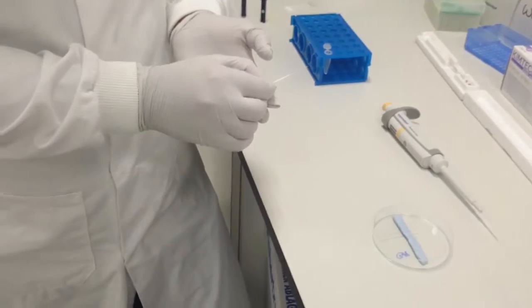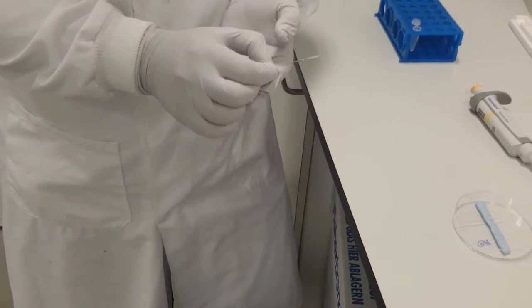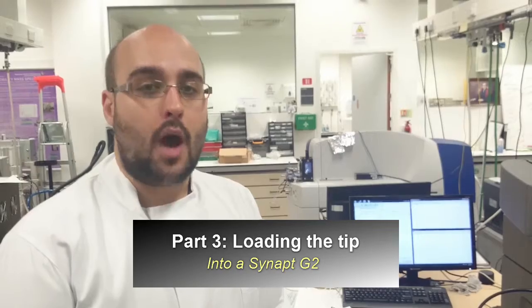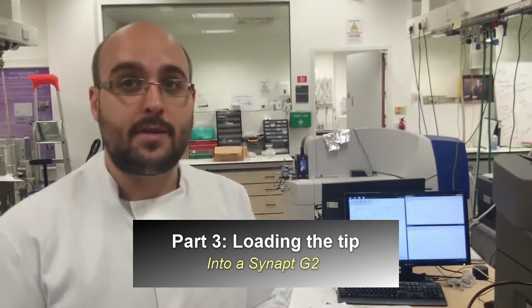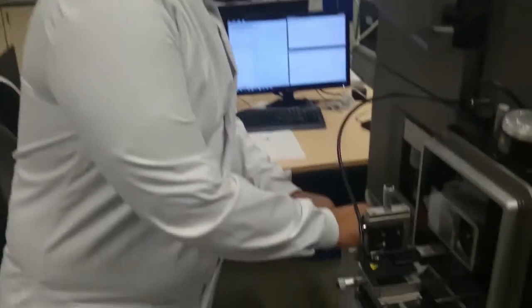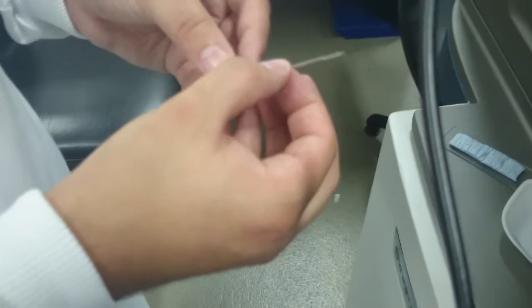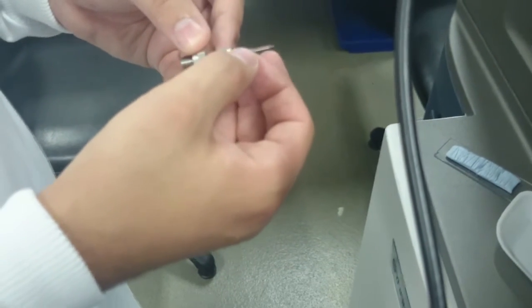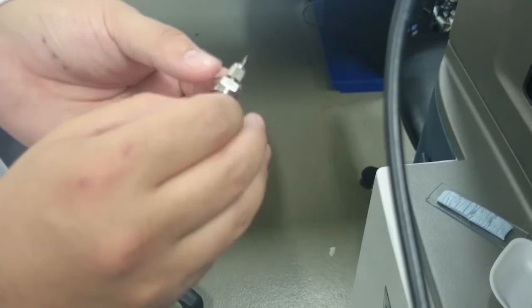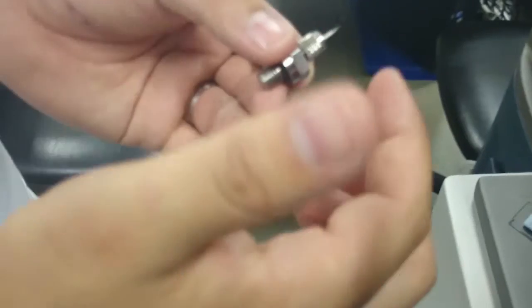When your sample is filled in a tip and air bubbles are free, you're going to take it to the instrument and get some signal. Now we've filled our borosilicate glass tip, we're going to place it inside the instrument and attain signal. When you have your glass tip, we're going to place it in what we call the carousel. Take care not to catch the end of the tip on anything around here, because that will break and you'll need to make a new tip. Also take care not to put bubbles in during this procedure, as it's the one stage that can actually put them in. You want, in the carousel, just a bit less than a centimeter sticking out the far side. And then you'll put your platinum wire in the bottom.